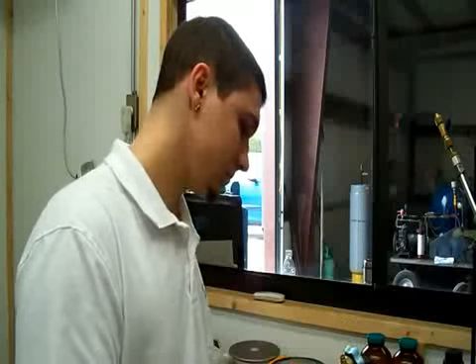That's great. So now you've got gas that's been certified by an independent lab, InterTeck, and that documentation, that certificate, goes with and follows that gas even after it's packaged. We can trace it back. Is that correct? That's correct.